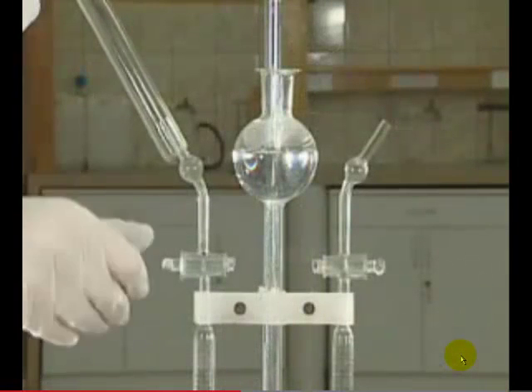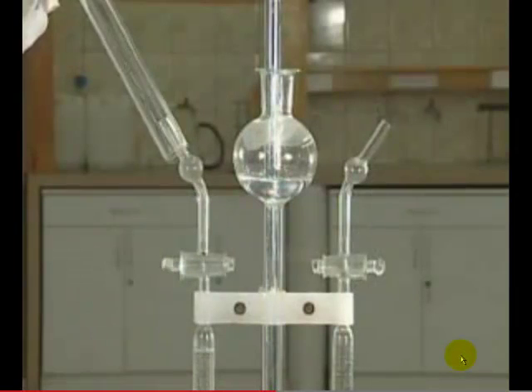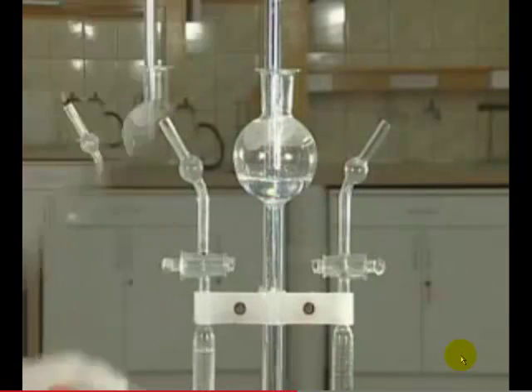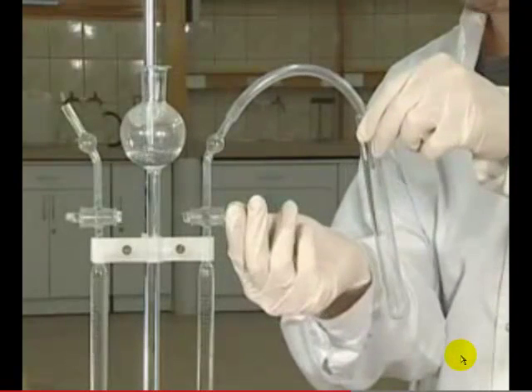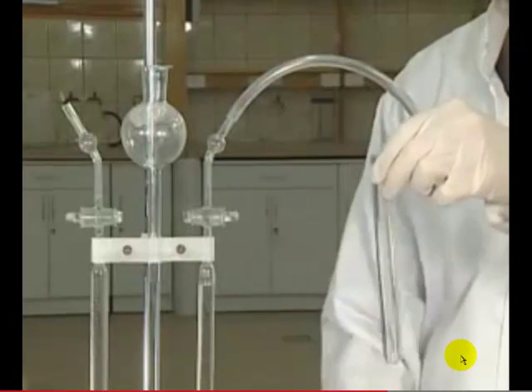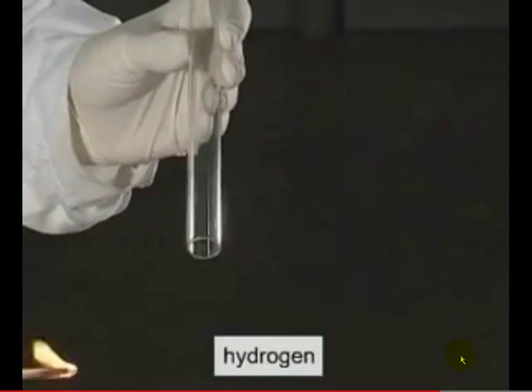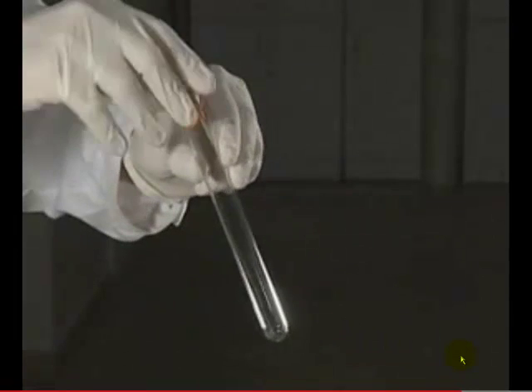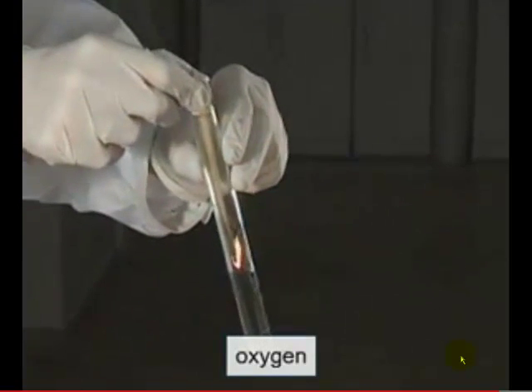To identify the gaseous products of the reaction, we collect each gas in a test tube and check its behavior in the presence of a glowing splint. The characteristic cracking sound proves that the gas released at the cathode is hydrogen. The ignition of the glowing splint is evidence that the gas collected from the anode is oxygen, which supports combustion.